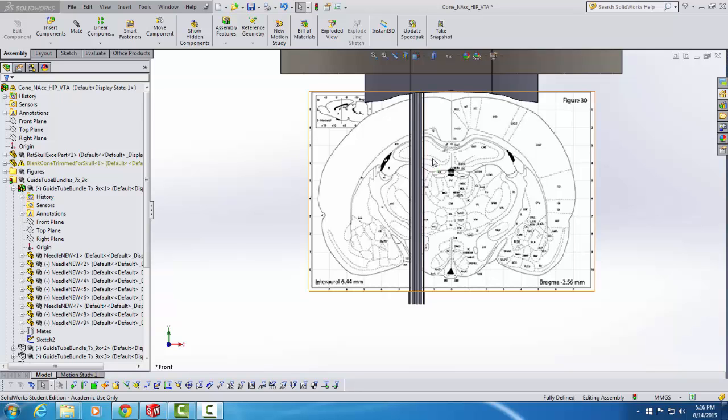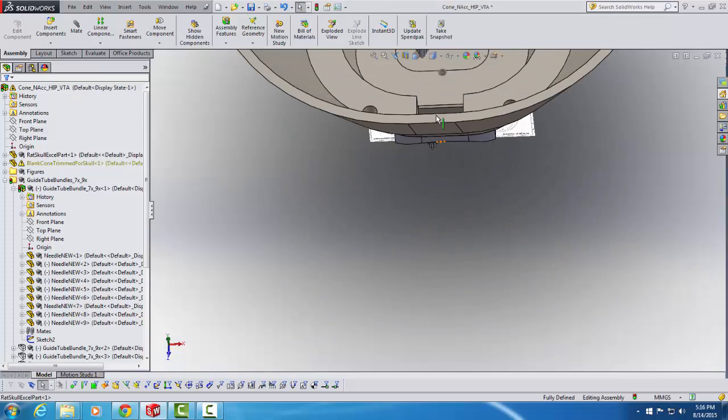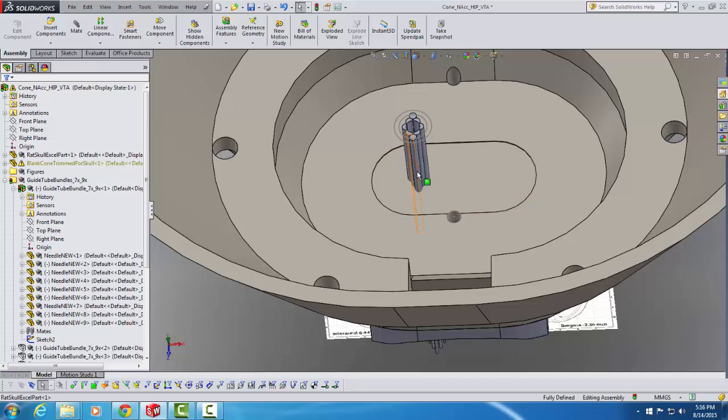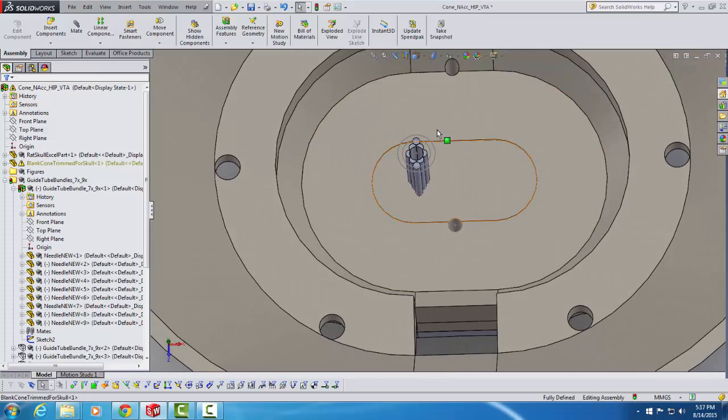My next step is going to be to drill a hole in the targeting cone that this guide tube bundle is going to pass through. This is the whole point of this exercise: to make this hole in the targeting cone so that when we print it, it will be in the proper position to target this bundle to the part of the brain that we're interested in. So you can see the top of the bundle emerging into the inside of the targeting cone here.